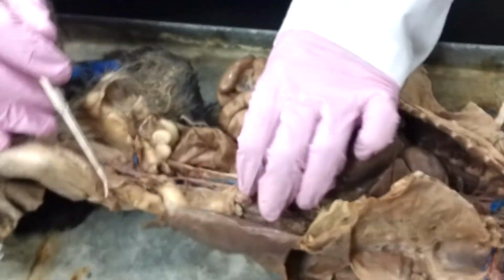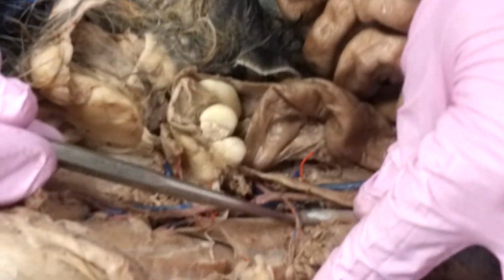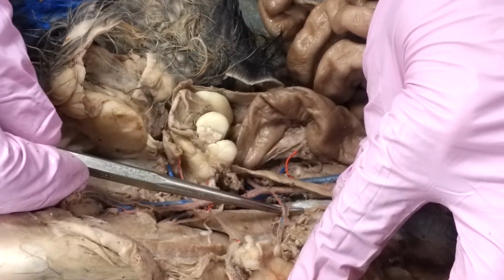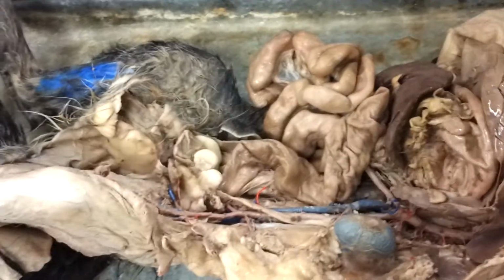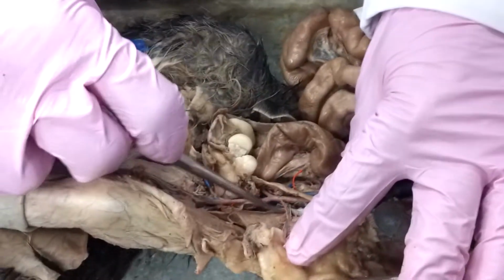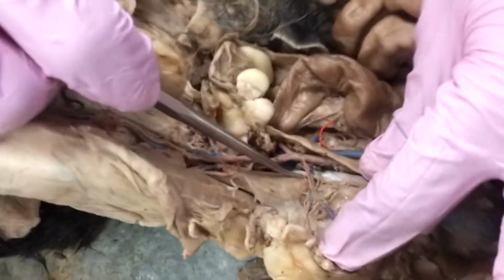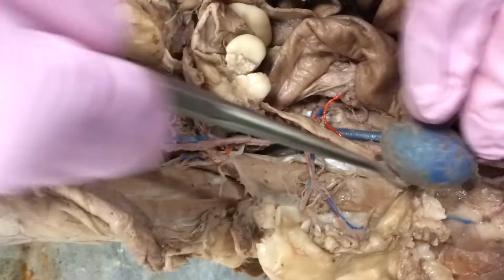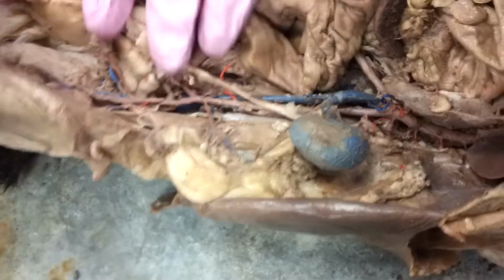The next one's going to be our iliolumbar artery and vein, and again, that's going to be going to the side of the lumbar spine, and it's basically right before the aorta branches into the external iliacs. It's going to be right here, and a nice clear picture of it, going right to the side of the spine. Perfect. Iliolumbar artery, iliolumbar vein, and our adrenal lumbar artery and our adrenal lumbar vein.